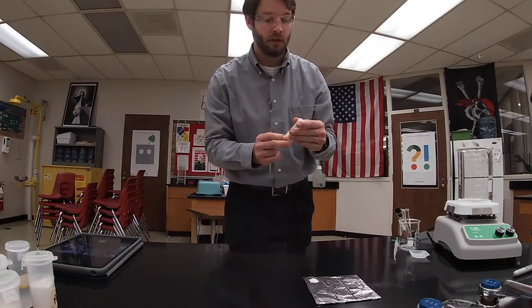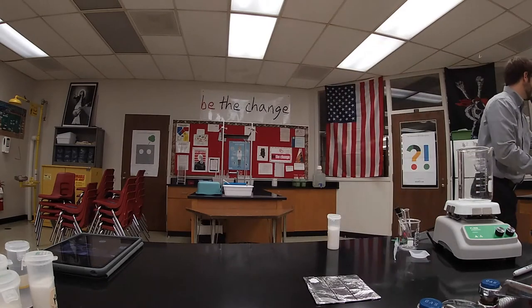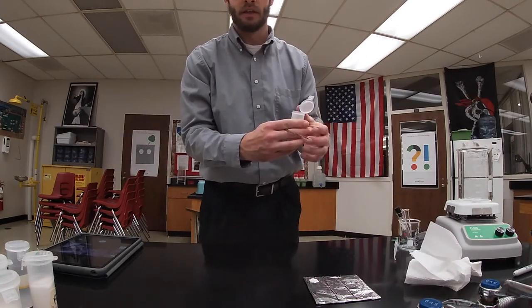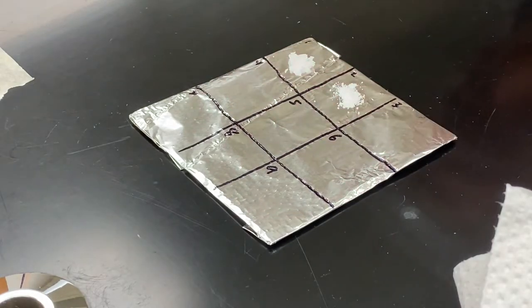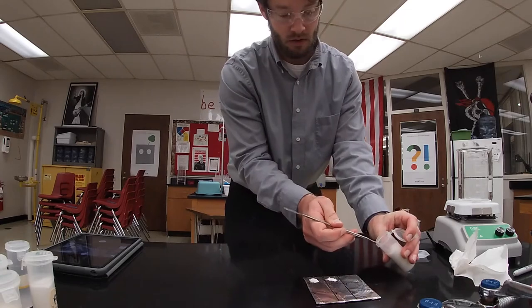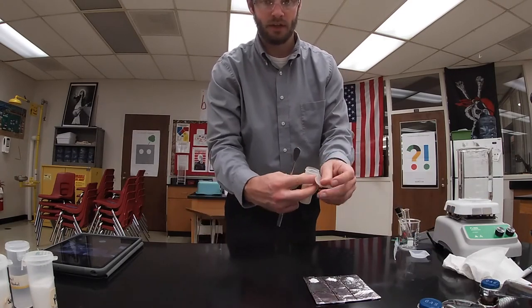This wax has been shaved with a grater, which is why it has that texture. To avoid cross-contamination, I'm going to wipe off my micro spatula with a paper towel between all transfers. The next one I have is magnesium sulfate, known as Epsom salt. Next, I have potassium chloride.